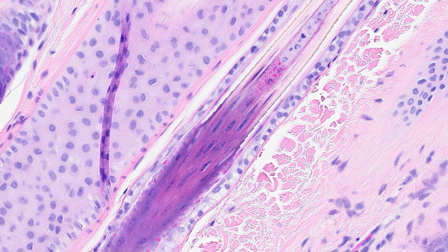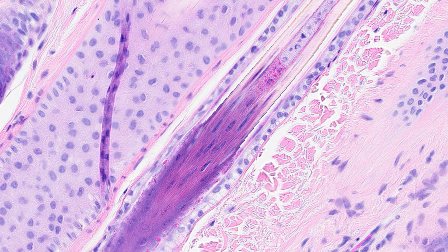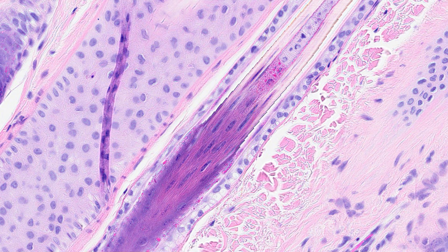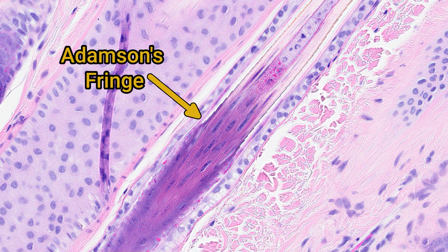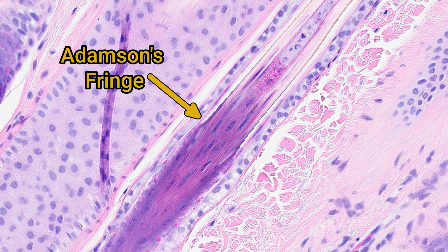In longitudinal section you can see each of the layers beginning to cornify, and you can even spot the point where the inner root sheath cornifies and separates from the hair shaft. This is Adamson's fringe, which demarcates the border between the isthmus and the inferior portions of the hair follicle.